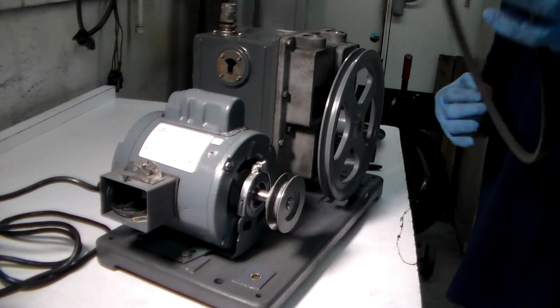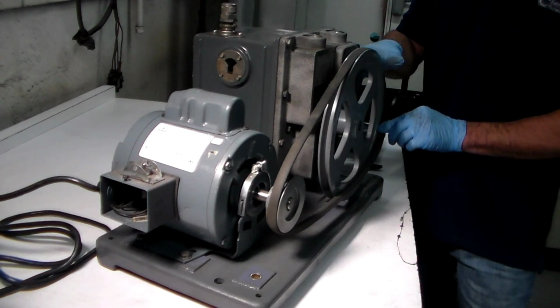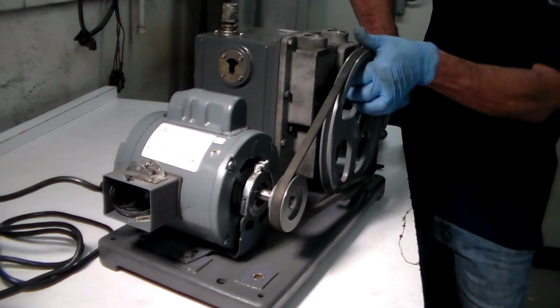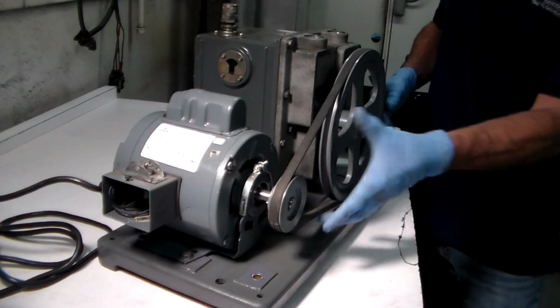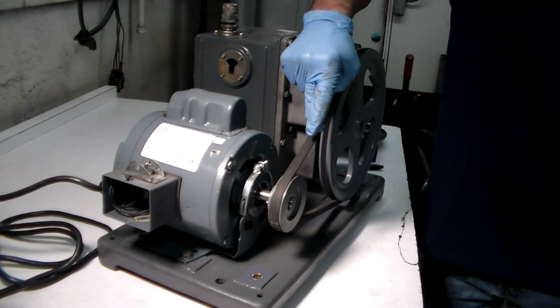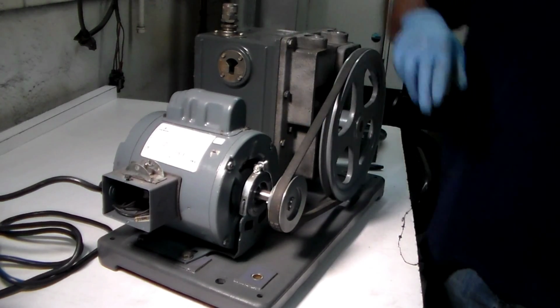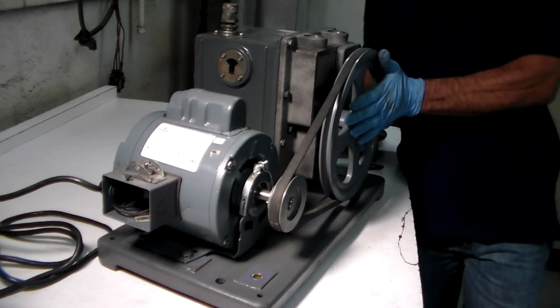Then you're going to take your pulley, your belt, and you're going to put your belt the same way I did before, right over the top. Take it and turn it, and it pops in place. Then you can see, in the video, you should have about a 1/4 inch of play on this belt, okay?